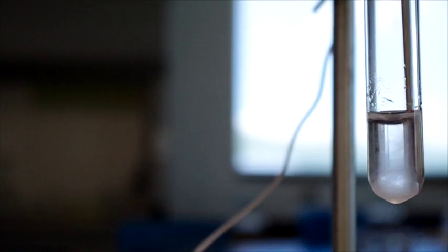You can see the crystals that have formed. Before long, we will have all of our potassium nitrate crystallized out again, but we will not leave our thermometer in there for that because it will get stuck.